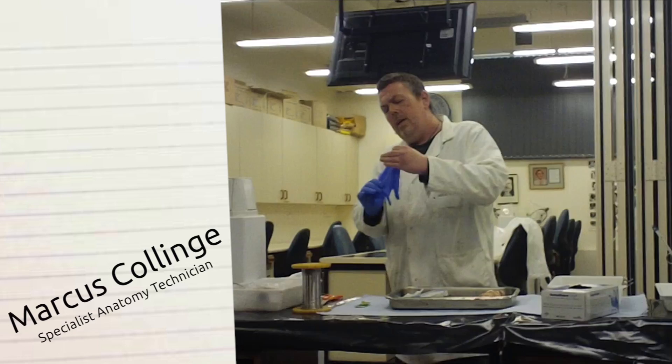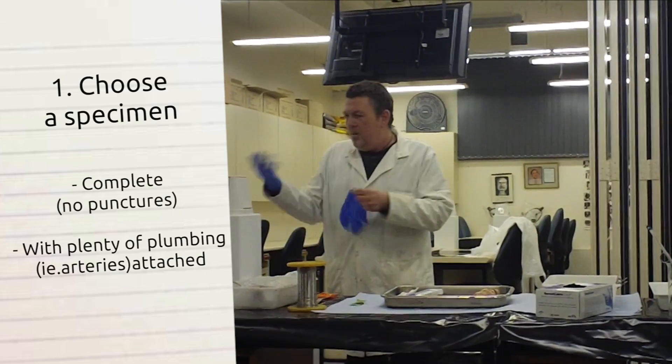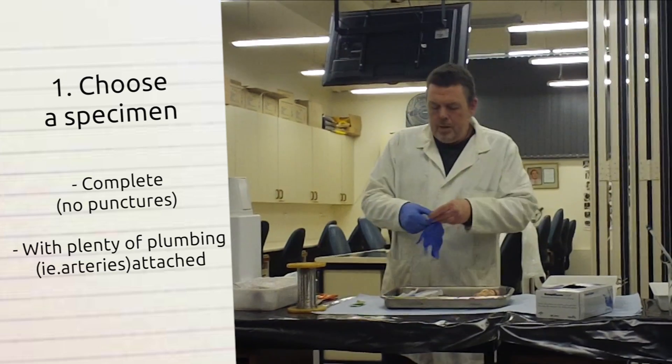If there's any punctures in the organ you're working with, it'll leak out. It's not much point. Don't give it that pressure. It just spills out. It goes everywhere.